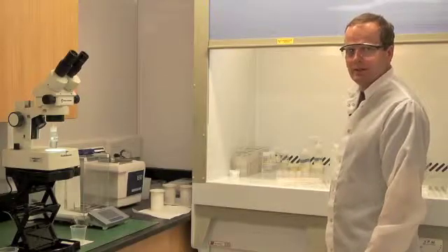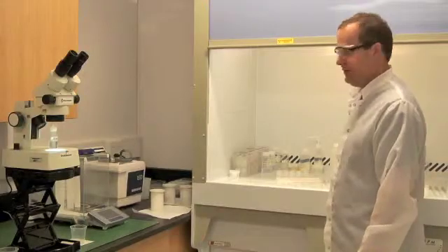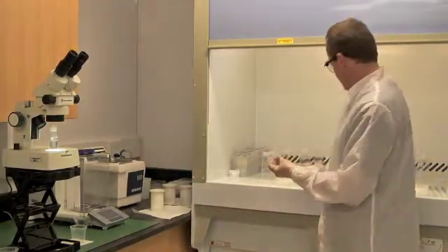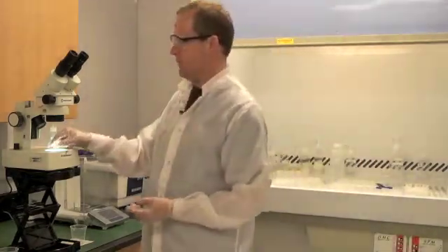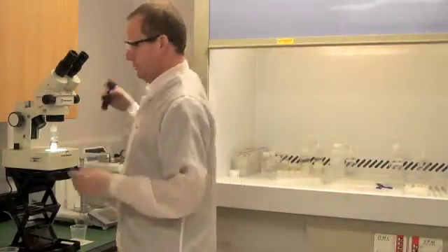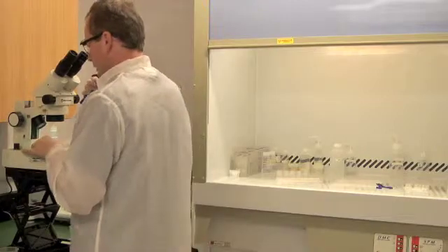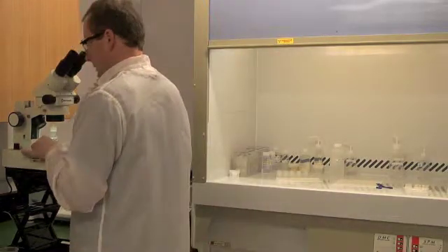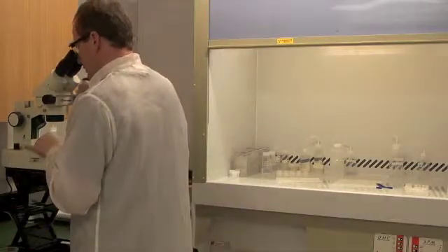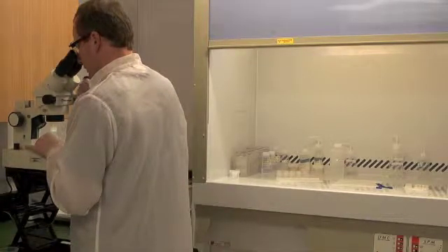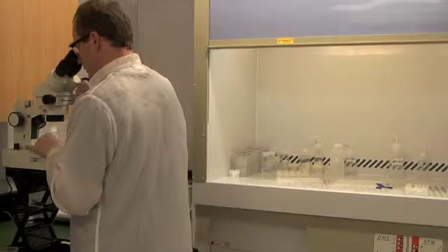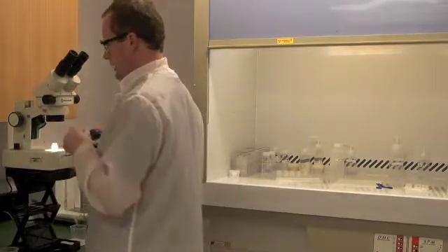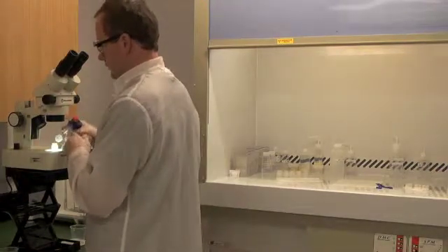I'm just finishing rinsing my zircons after chemical abrasion. This beaker contains one of those zircon crystals that I emptied out of the microcapsule. I'm going to bring it to the microscope, use my pipette to capture the grain, discard the liquid, put the grain back in the beaker, and remove as much of that liquid as I can, recalling that that has dissolved zircon in it from the chemical abrasion.